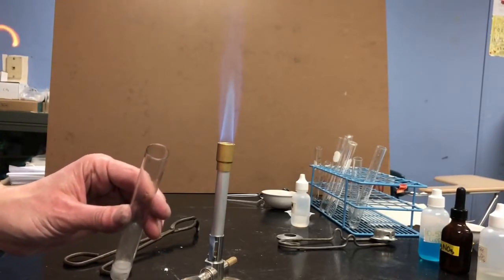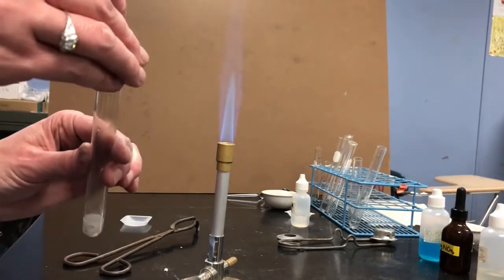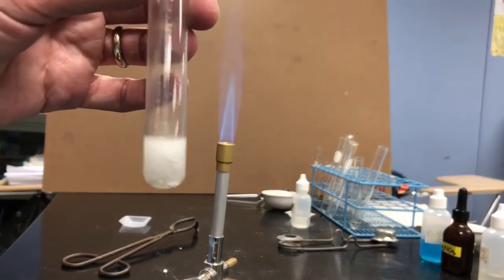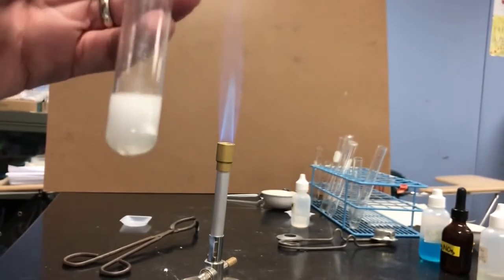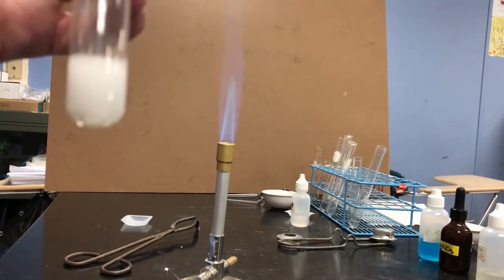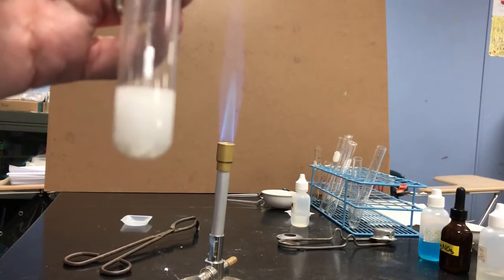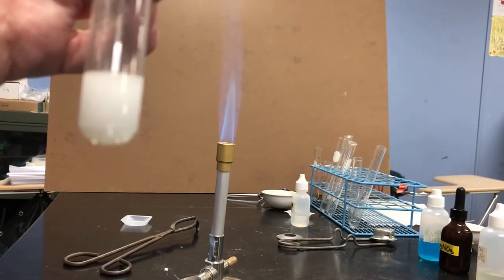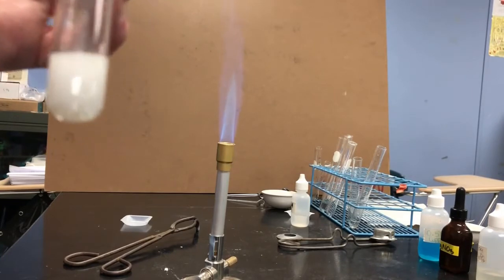So that was a squeaky pop noise, which is standard for a particular gas. Again, from your background information section, you should know what gas makes that squeaky pop noise when a lit splint is brought nearby. Now, we will need to see how this looks when the reaction is finished, because right now there are so many bubbles, I can't even see. I don't know if the liquid is now white or if it's just white because of all the bubbles happening in it. So I'm going to set it to the side and we'll look at reaction 3 later.